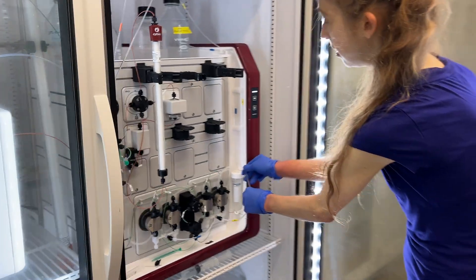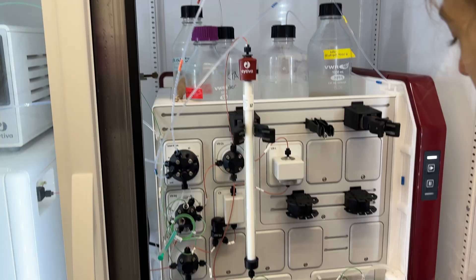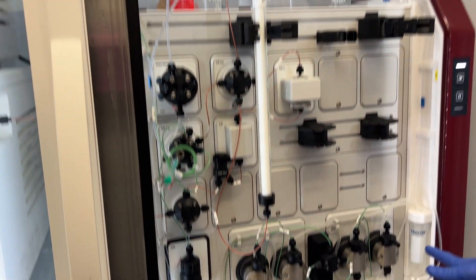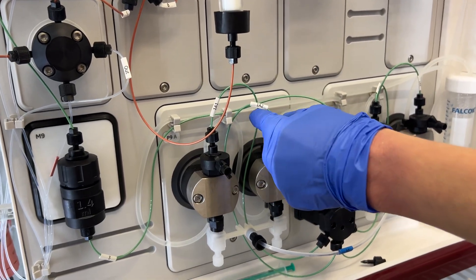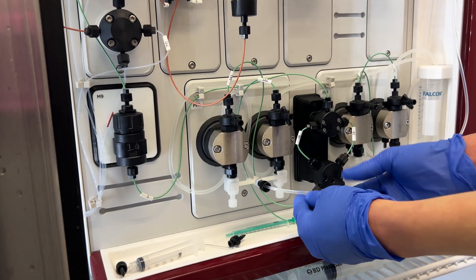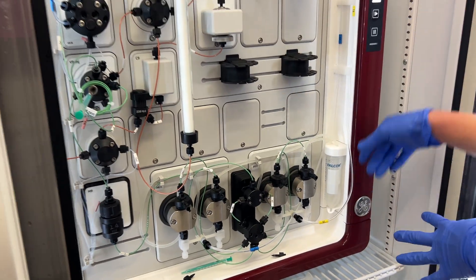You never want air to be in these clear tubes — the ones that are actually going into your liquids, like your A1 line, your A2 line, those sorts of things. Note also that the pump heads are labeled like 1A1 and 1A2, but those are just the two pump heads — they're both going to the A1 line, which is the only A line that we currently have.